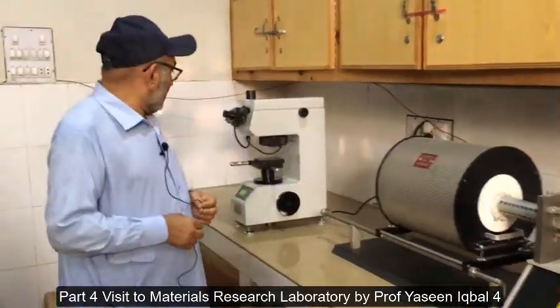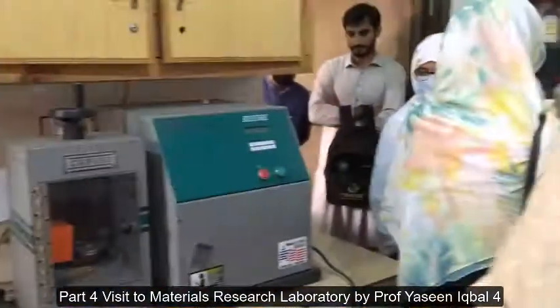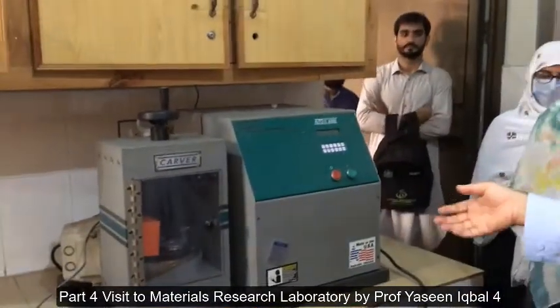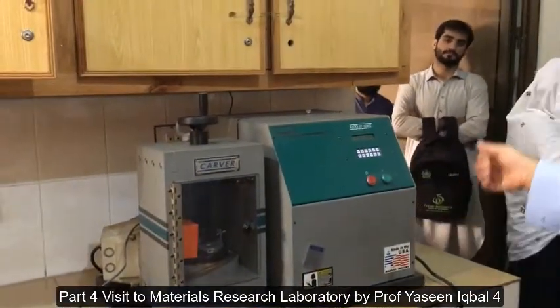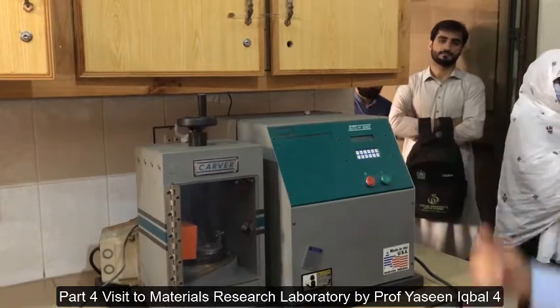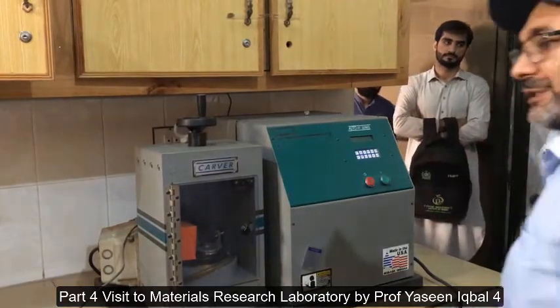This is an ordinary optical microscope. This is the auto pellet press. You select a specific pressure, switch on the button, and it presses the material.